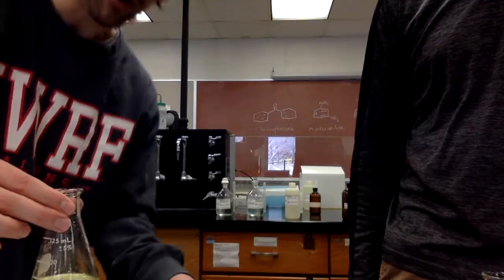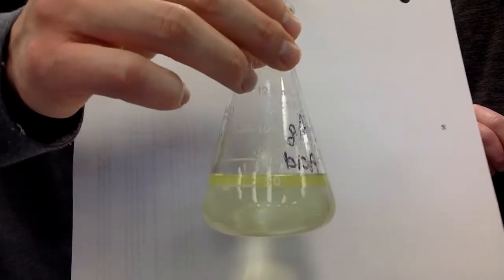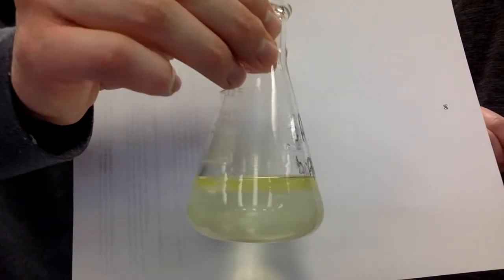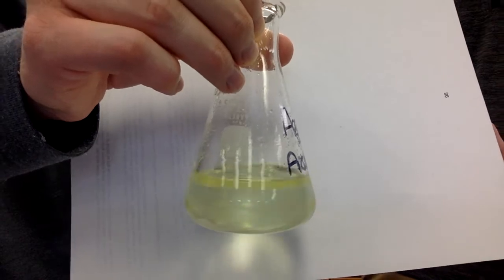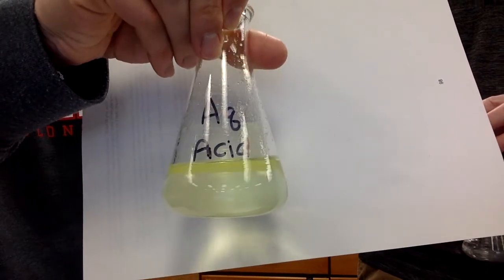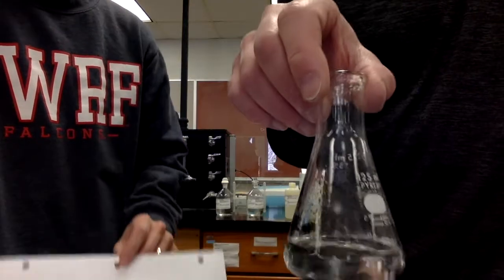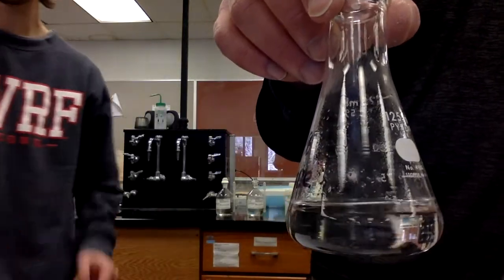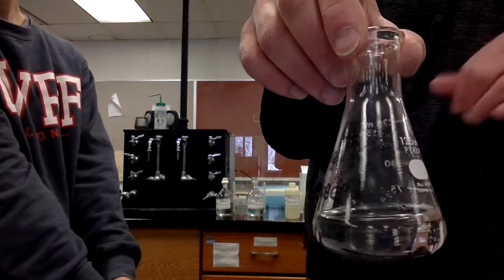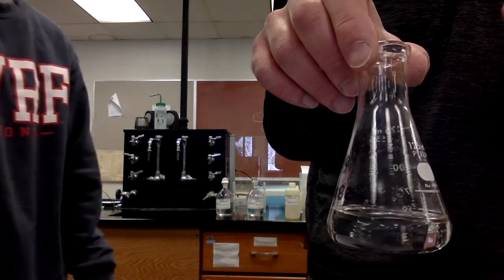We'll report back. All right, so we've added our MTBE to these, and what you can see with the Erlenmeyer flask is that we clearly have 2 layers now, the top layer, the organic layer, and the bottom layer being the aqueous layer. And you can see the color of the one that turned yellow is now in the organic layer. Yep, the other one didn't do anything all too interesting, just the 2 layers. So what we'll do now is we're going to spot the organic layer from each of these flasks onto the appropriate lanes of our TLC plate, and then we'll get that TLC plate developing, and we'll report back when it's done.